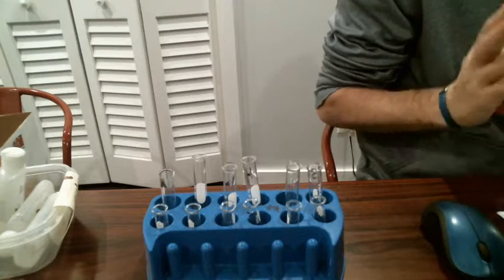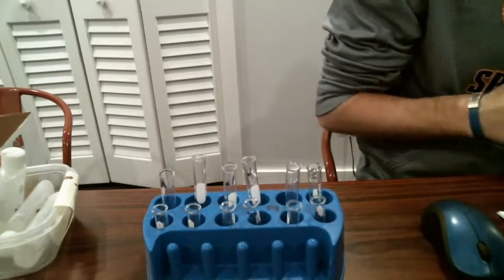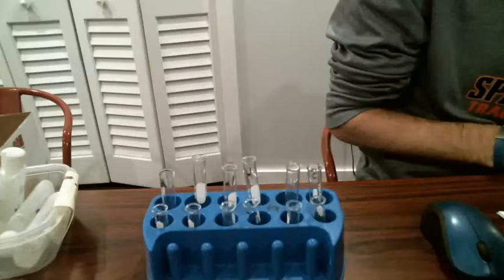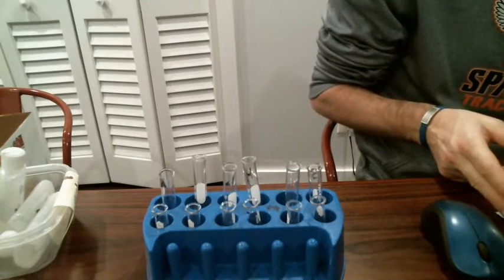Let's just take a look at these first four reactions today. Now, for this first part of the video, as you go through this, you should write and balance the molecular equation, and then make some observations.